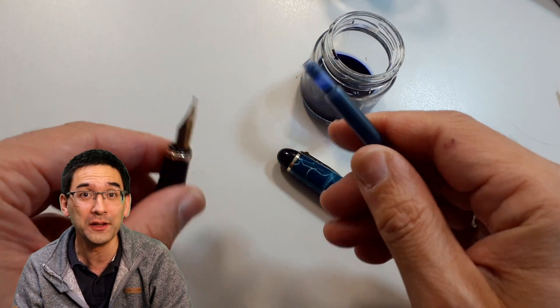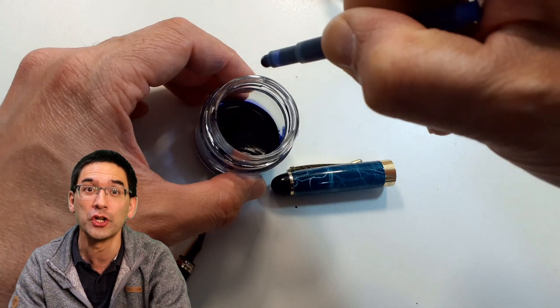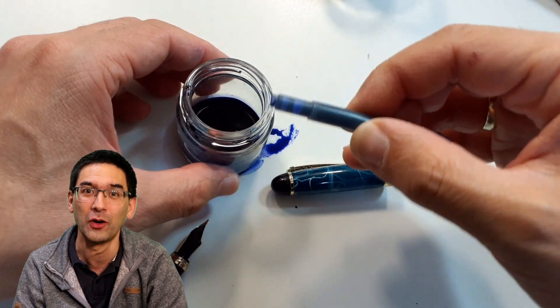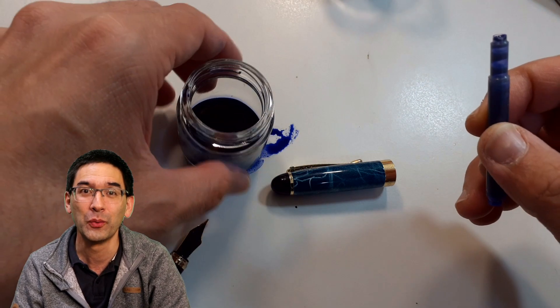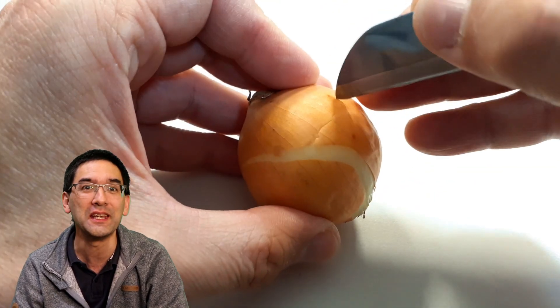I like to use the blue one. You simply take it out from an ink cartridge. You do not need more than just a few drops. If you actually want to use more, then I recommend that you also buy yourself a full ink bottle.